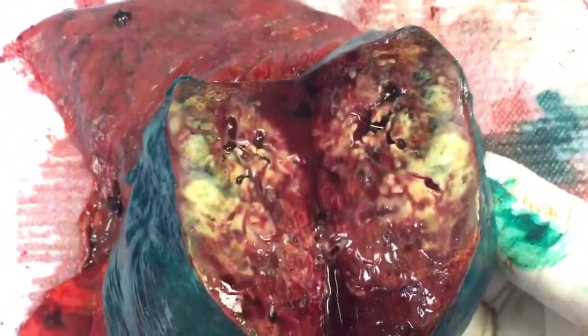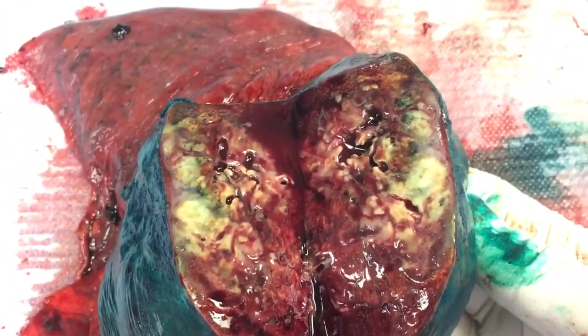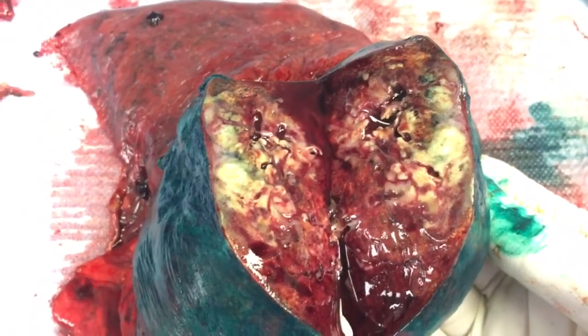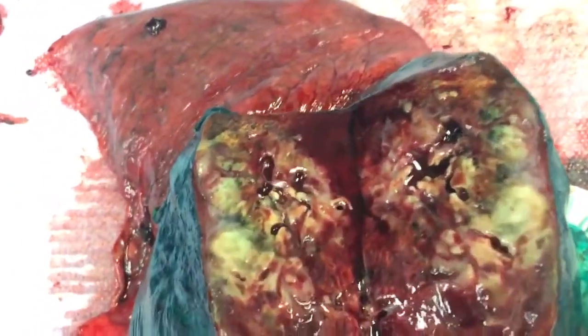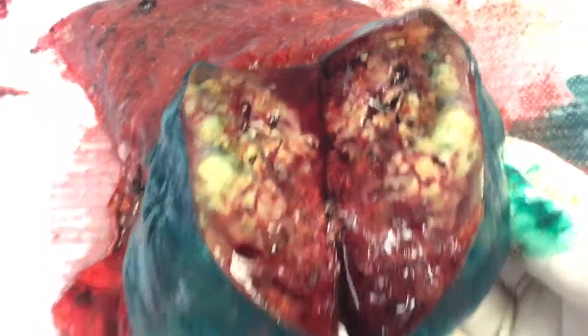I'm going to show you here — it's all tumor. Red is hemorrhage. Yellow is tumor. And then some cavities — see those little cavities? That's some necrosis.